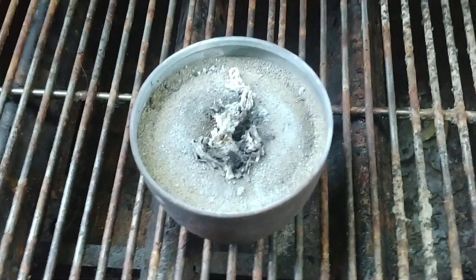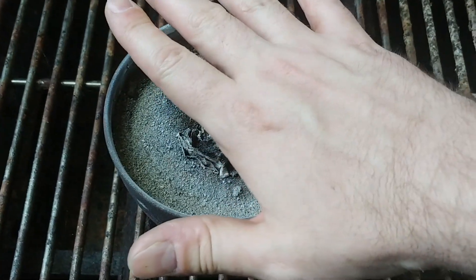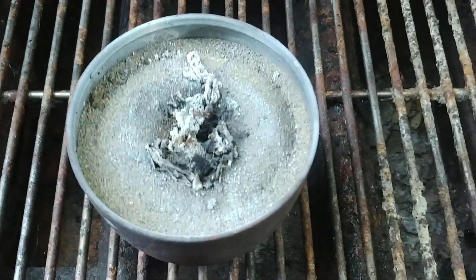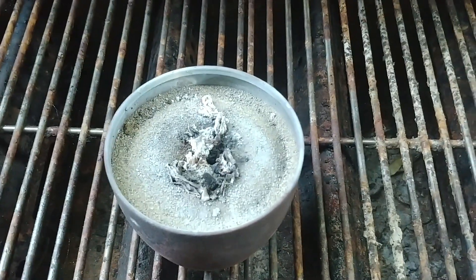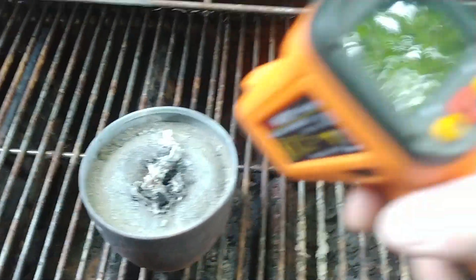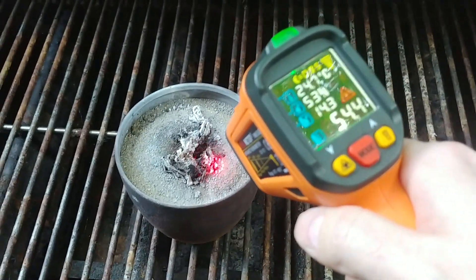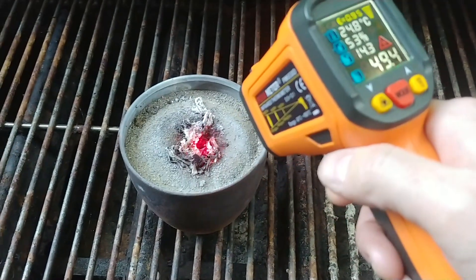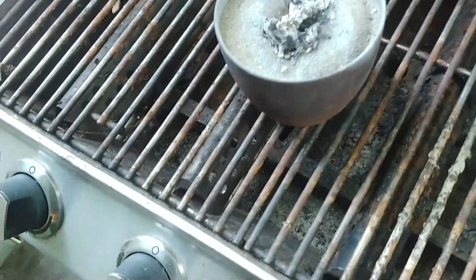I was not able to continue my previous video because I wanted to wait plenty of time. I can still feel a fair amount of heat coming off that, and I think it's been around 15 minutes since I stepped away from this. So right now I'm gonna see how warm that is, just on the surface. Yeah, around 60 right there on the surface, so I imagine it's still quite hot down towards the bottom because it's well insulated.